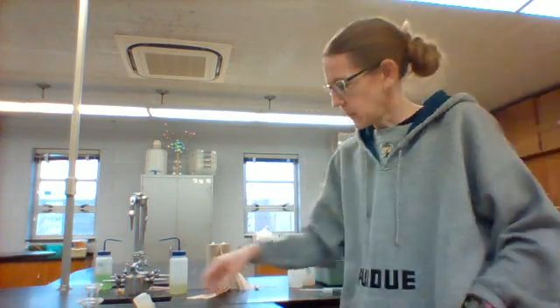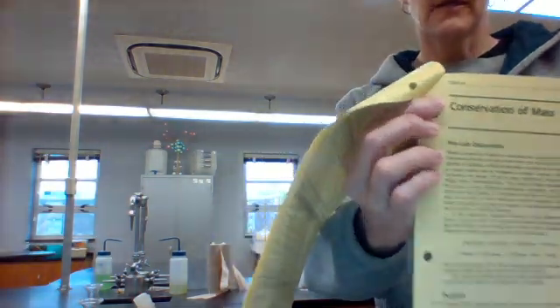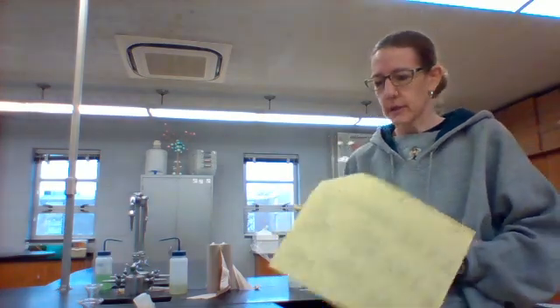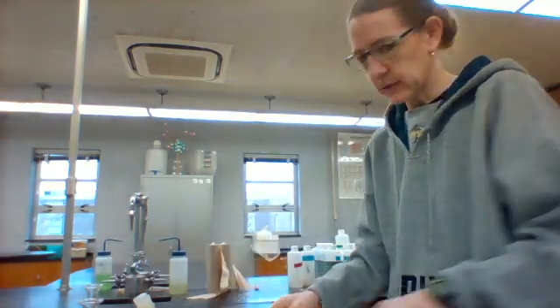Okay, we are going to look at Lab 9 here today. I'm going to go ahead and do the data collection for you guys so that you can at least look at some of these numbers and be able to do the lab remotely.